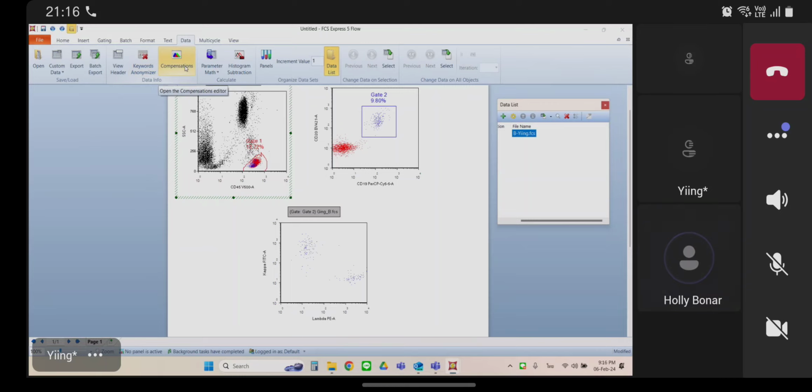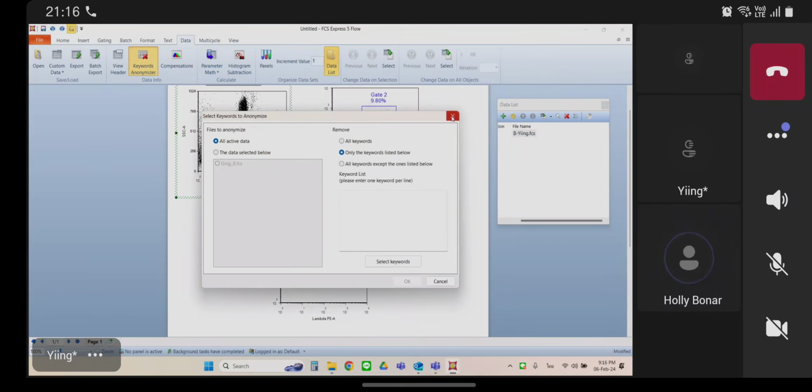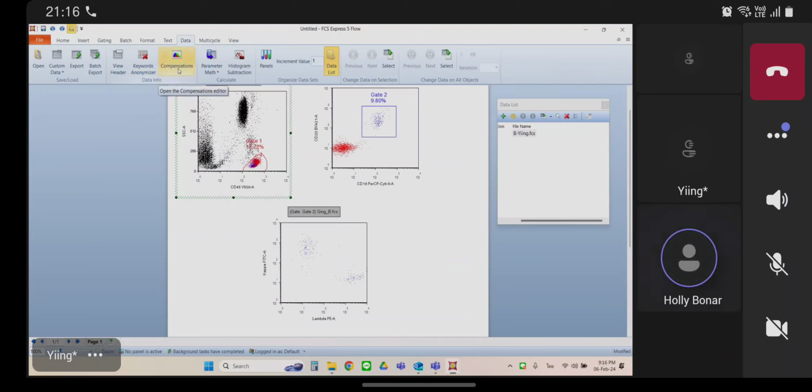One more, go to the left. There's compensations, there's keywords, anonymizer. The other direction. And one more, not that one. Go over one more, the other way. Keep going. There we go.